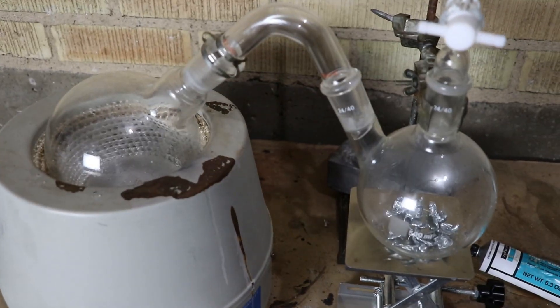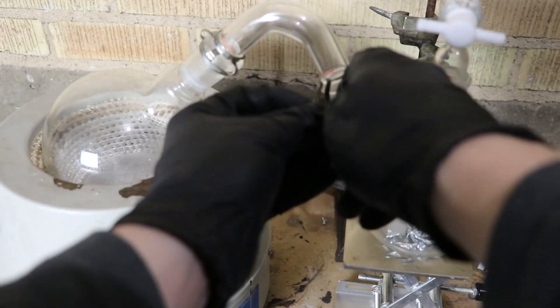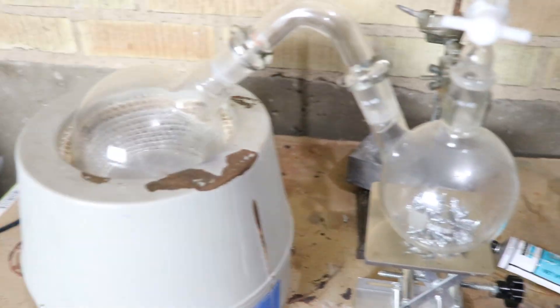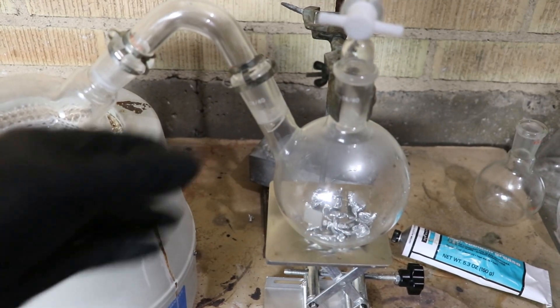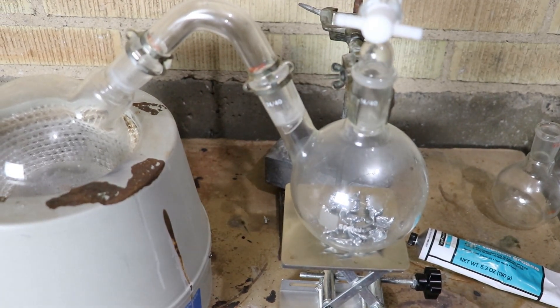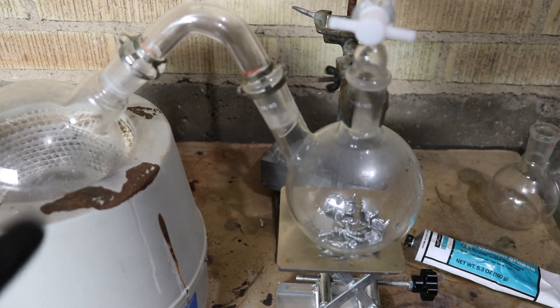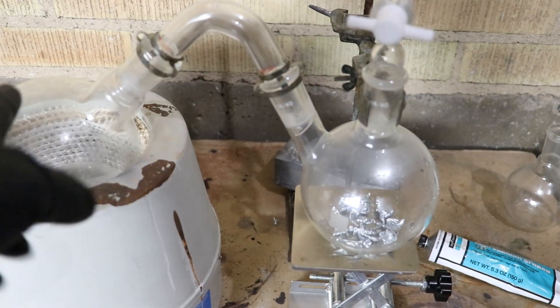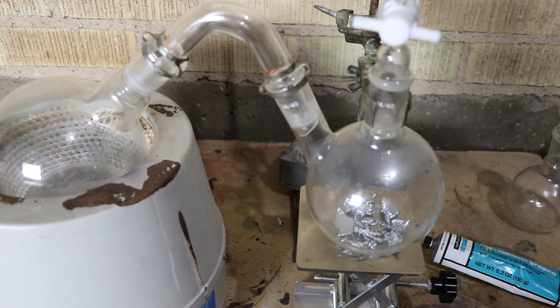So I may have this in a heating mantle but I don't intend to heat it. I'm just using this for the stirring. A little stir bar in there. I'll put on a strong stirring so I can get that all whipped up into a froth. Let's actually turn that off for now. Right now I'm assembling the glassware. So I've got some high vacuum grease on all the joints. I am going to vacuum out all the air. I don't want any oxidation to be occurring while I'm working so I need to remove all the oxygen.